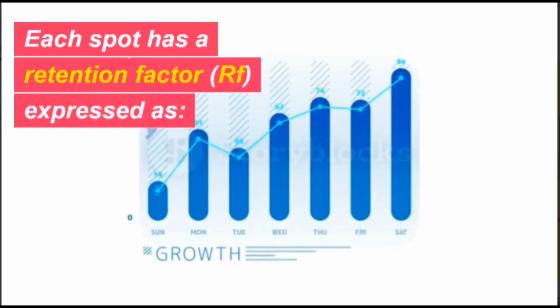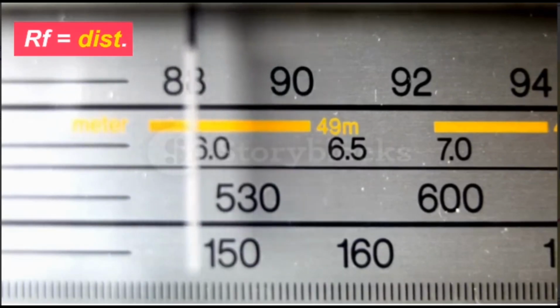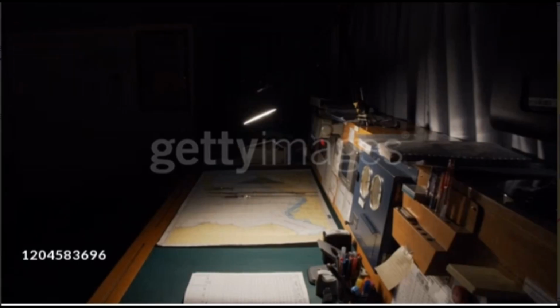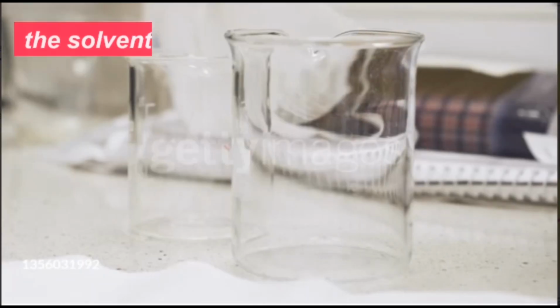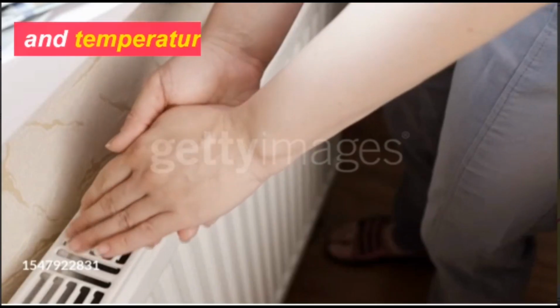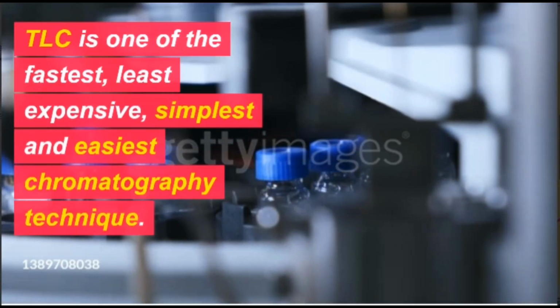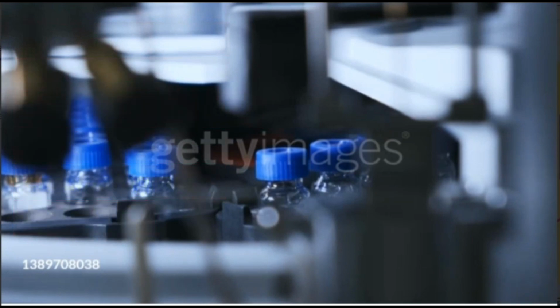Each spot has a retention factor, RF, expressed as RF equals distance traveled by sample over distance traveled by solvent. The factors affecting the retardation factor are the solvent system, amount of material spotted, adsorbent, and temperature. TLC is one of the fastest, least expensive, simplest and easiest chromatography techniques.